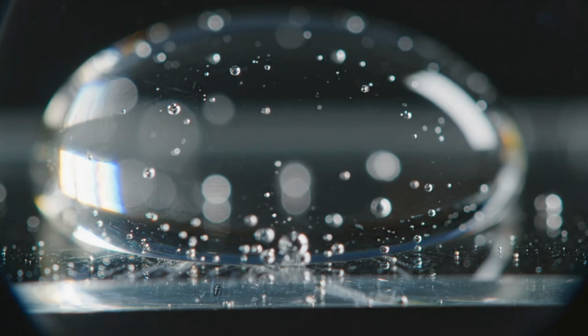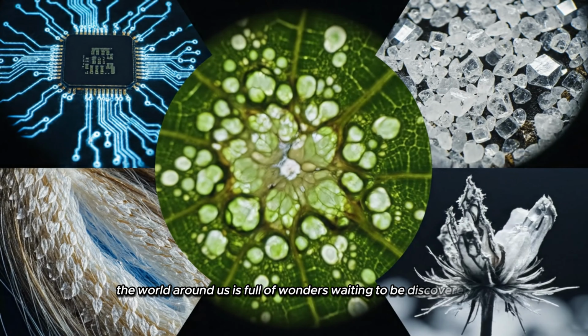Finally, a single drop of water. At 10x, we see tiny bubbles and particles floating. 100x uncovers microstructures and movement within, and 400x transforms the drop into a universe of shapes, alive with detail and mystery. The world around us is full of wonders, waiting to be discovered.